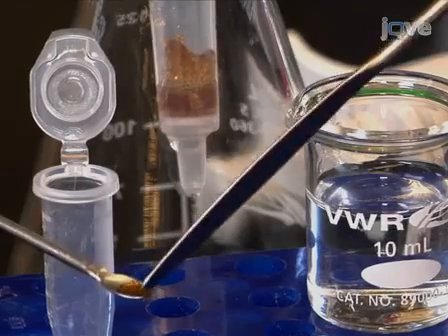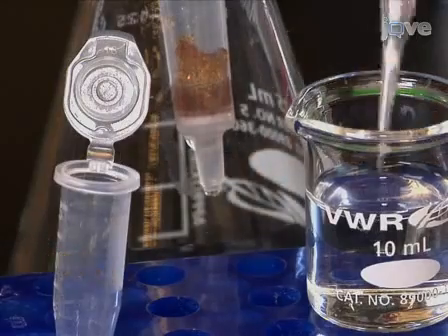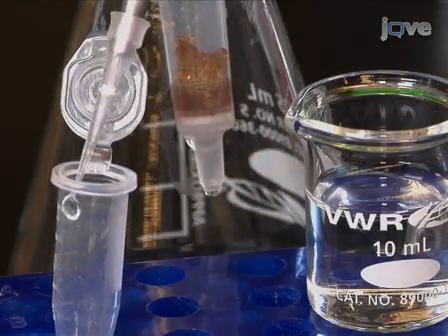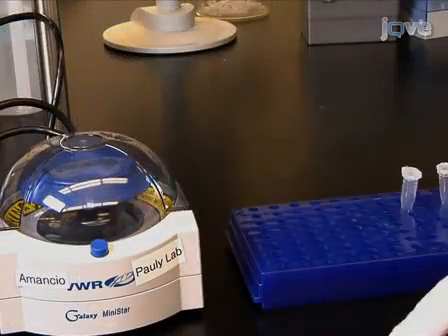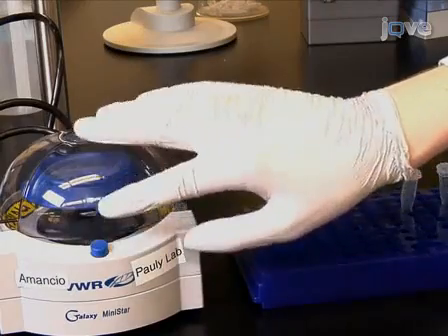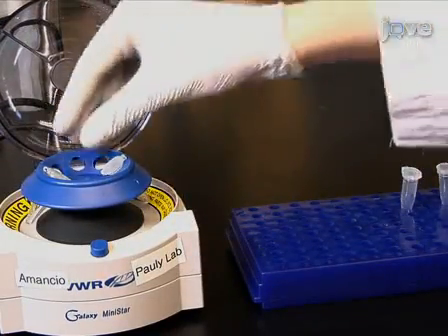Add 5 to 10 conditioned Biorex cation beads to the digested and dried sample. Then add 10 microliters of water. For lower amounts of material, 5 microliters of water may be used. Immerse the beads in the solution by briefly spinning the tube. Incubate for at least 10 minutes at room temperature.